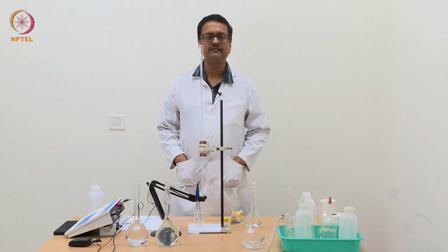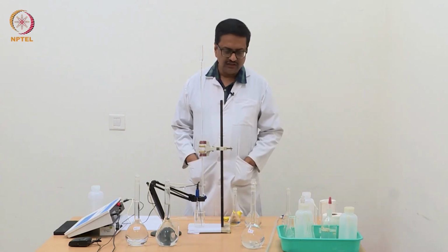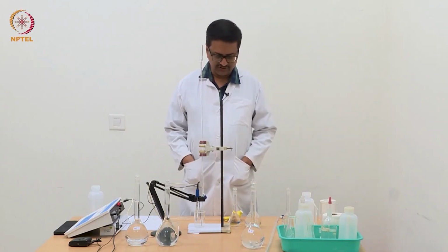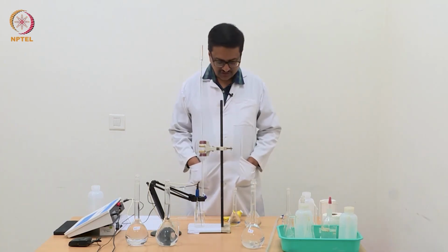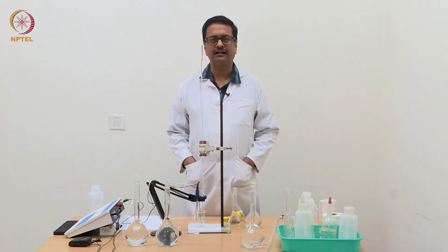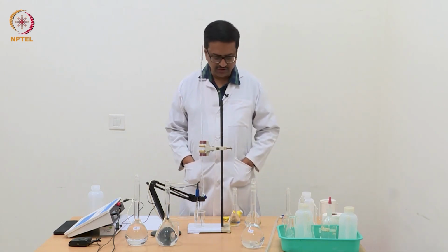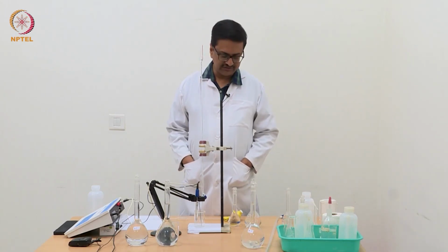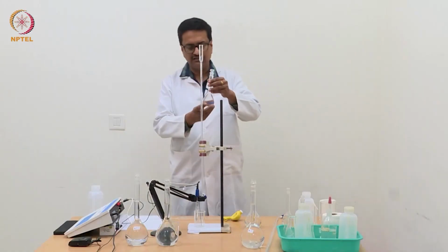Welcome back to the experimental sessions for the course Elementary Electrochemistry. In the previous videos, we have demonstrated two experiments of potentiometric titrations, one using strong acid and strong base, that was with HCl and NaOH, and the second one was a weak acid and a strong base, that is acetic acid versus NaOH. So now in this third experiment, I am going to use a weak dibasic acid, which is here.